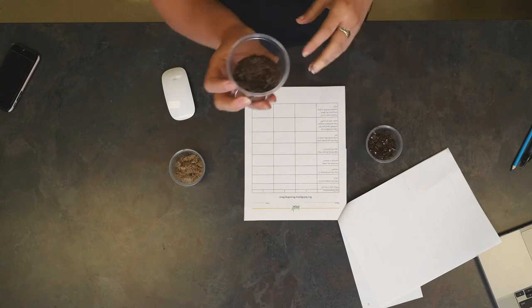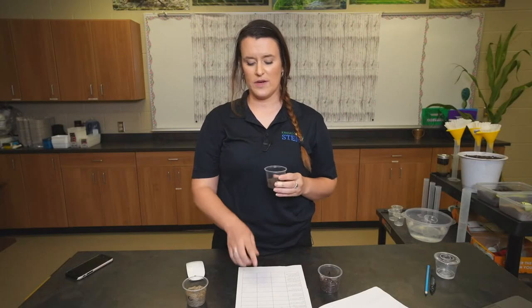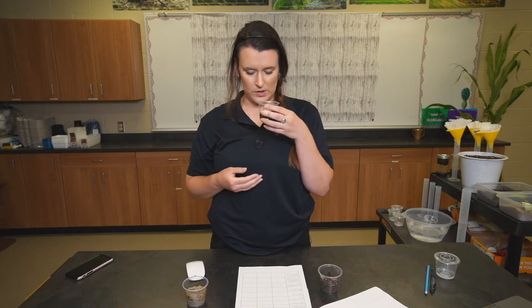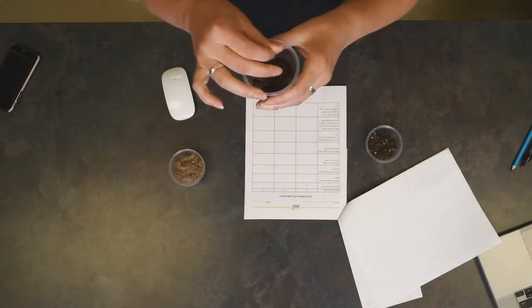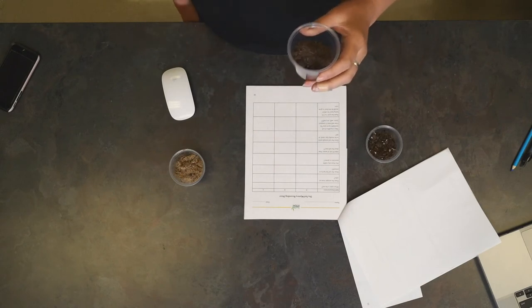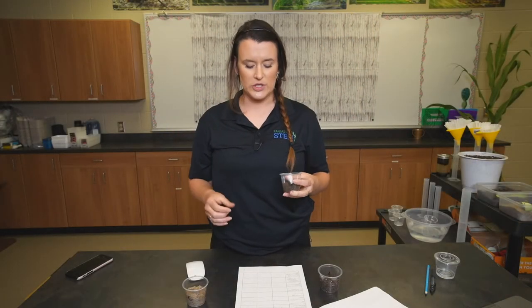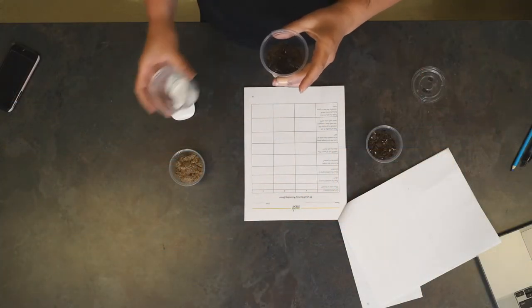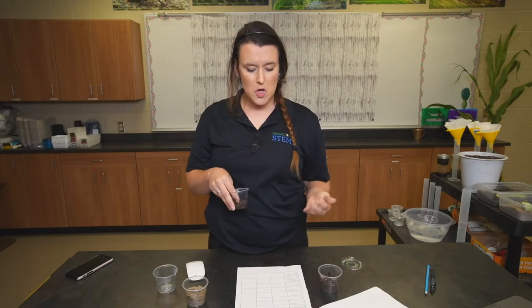I have my B soil here. I'm going to look at it, come up with the color, and record any observation in the B column. Does the sample have an odor? You can teach them a wafting technique or have them get a little closer — either is fine. Ask if the soil feels gritty, so they'll do a finger test. Are there any visible particles or grains? A hand lens is great here, or they can dump a little out and spread it. Then add 20 milliliters of water.